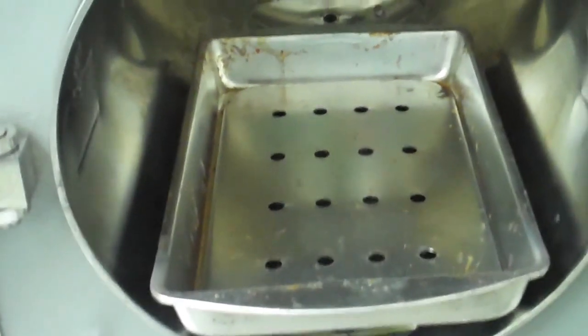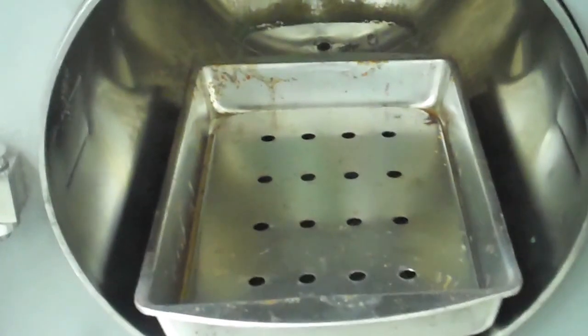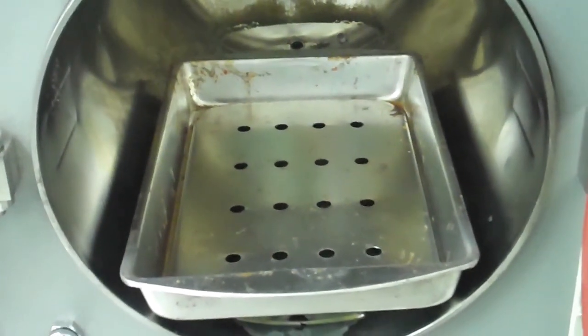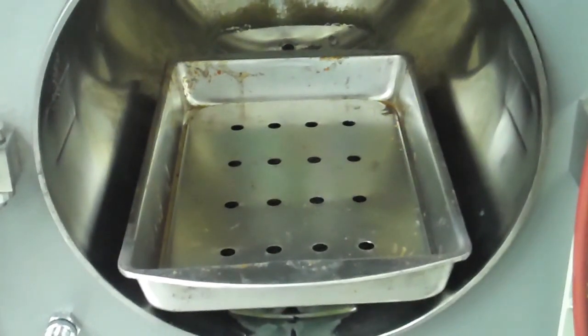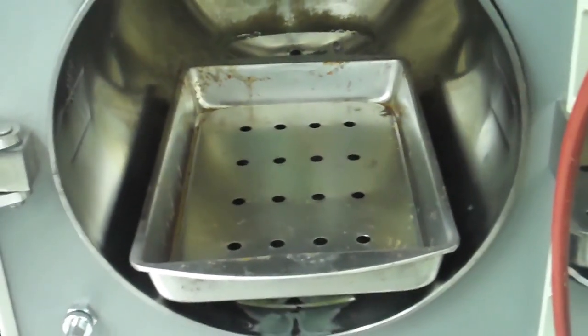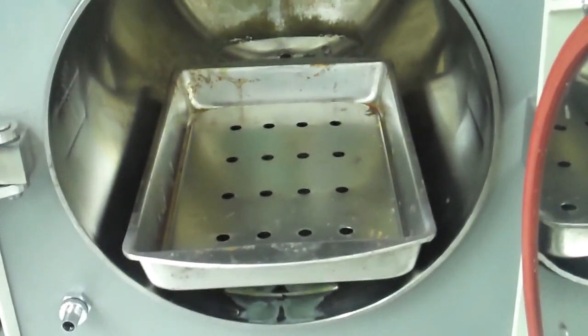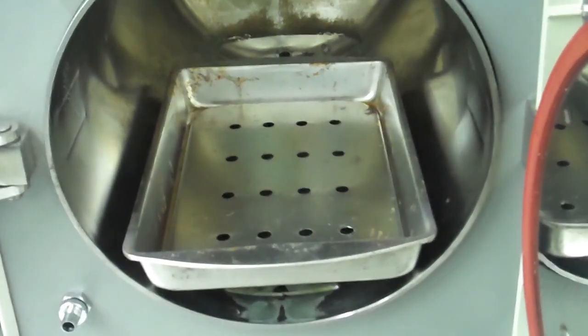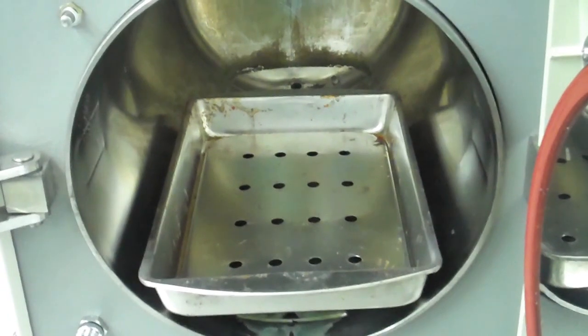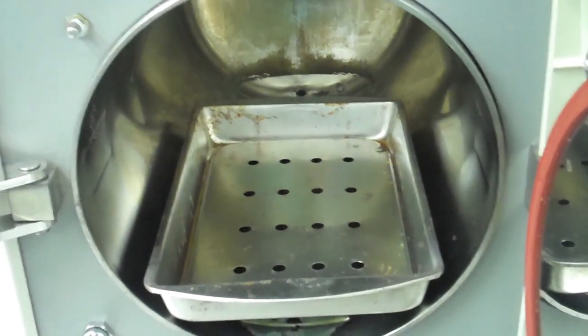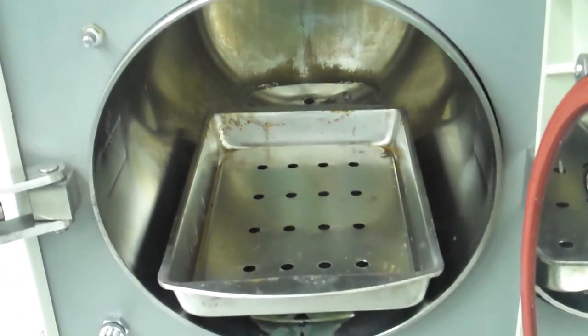The autoclave is intended to have distilled water steam pressure, and that is used to cook what's inside here to destroy all the bacteria. You must always take precaution to make sure that you don't boil over whatever you put in here. If you're putting in bio bags, you don't want to have so many stuffed in there that when gel melts it somehow escapes the bag.